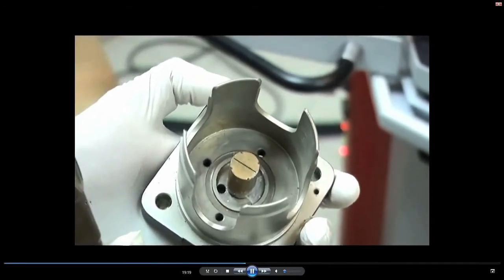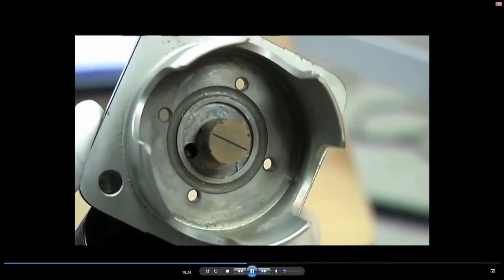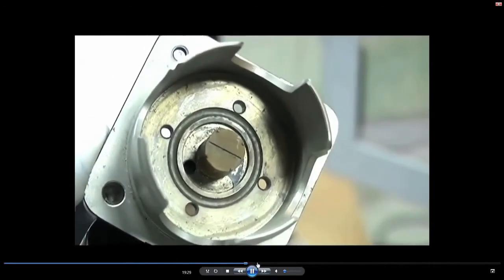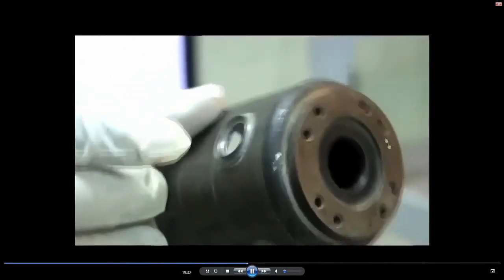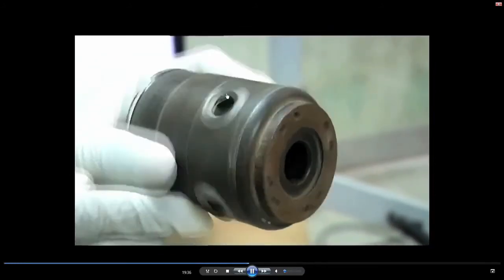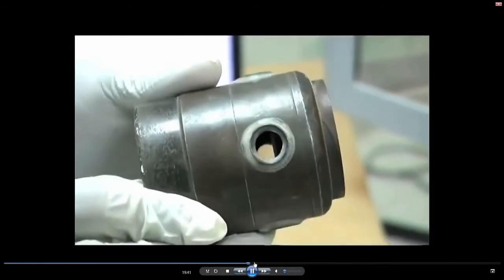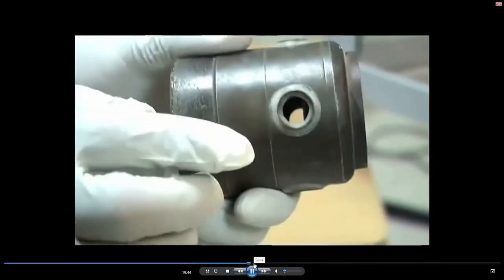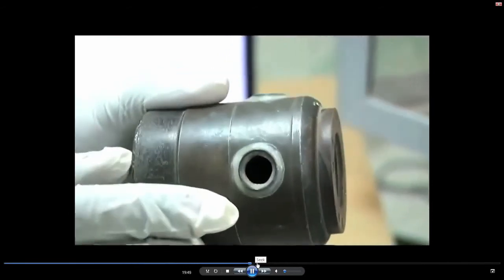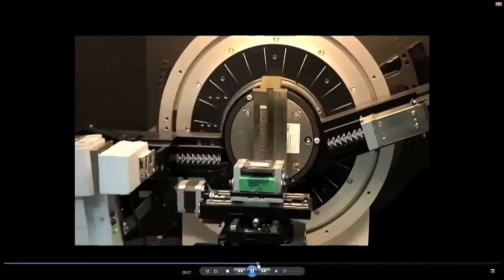And what the other dismantled part is, okay, this is a close-up view of this anode, just for your information. And this is that beryllium window which we talk about, through which the X-rays will come out. This is a dismantled part. Not that important here, but just for information, this is how the X-ray tube parts are shown.